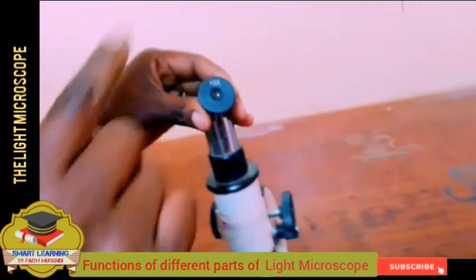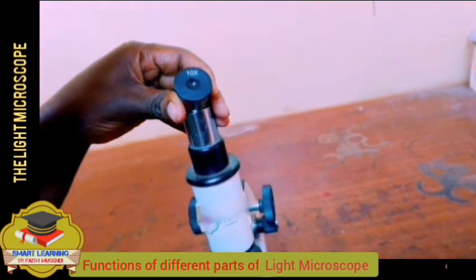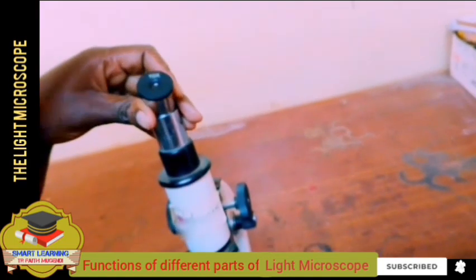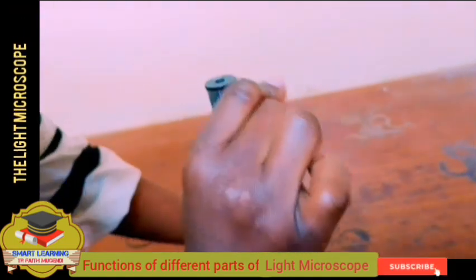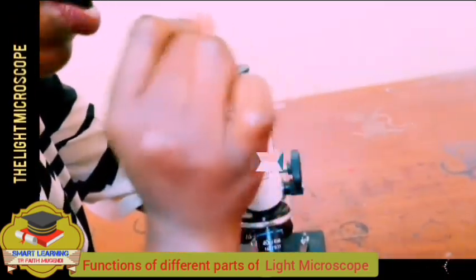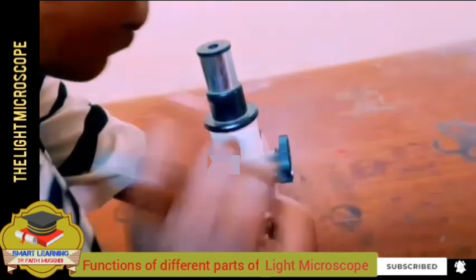Then the image that I see with my eyes is magnified 40 times and then 10 times, so the total magnification will be 400 times. That is how a microscopic organism or cell can be observed using a light microscope.